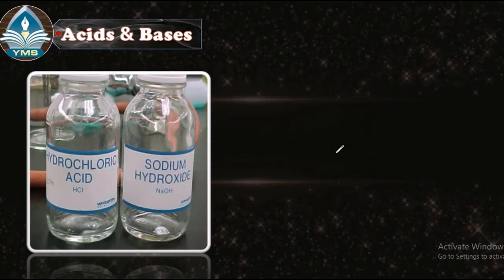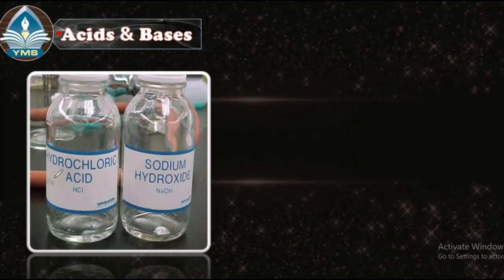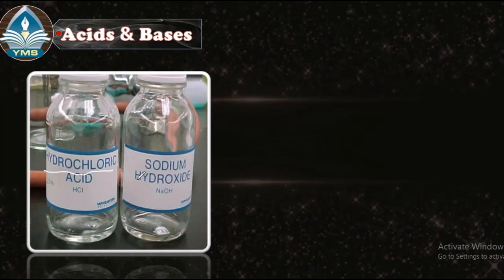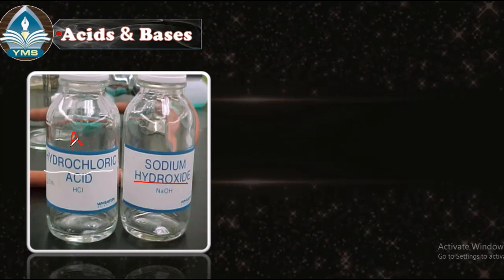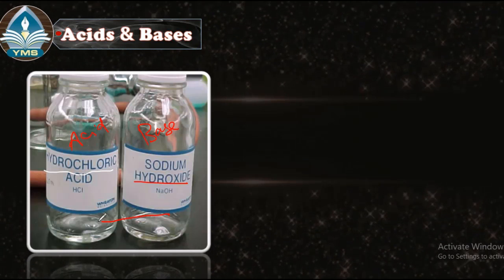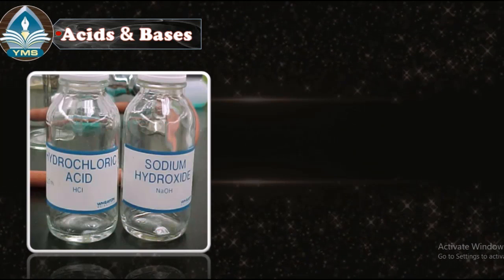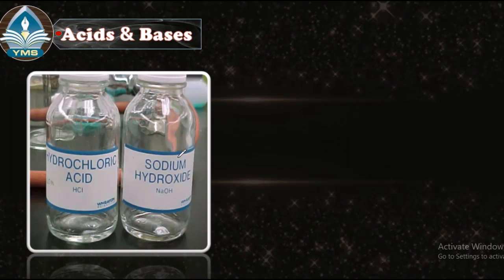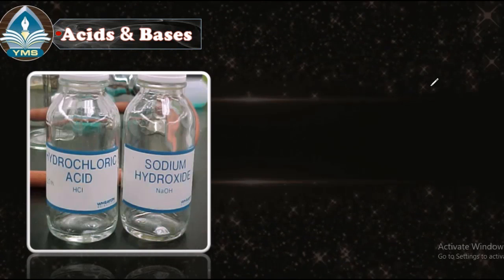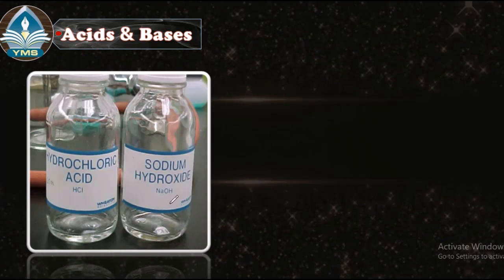We talked before about acids and bases, but if we look here, this is hydrochloric acid. And in the other bottle, this is sodium hydroxide. So this is an acid and this is a base. But if you look here, on this side and here, they look similar. You cannot differentiate if there are no labels to read. How can we know which one is an acid and which one is a base?